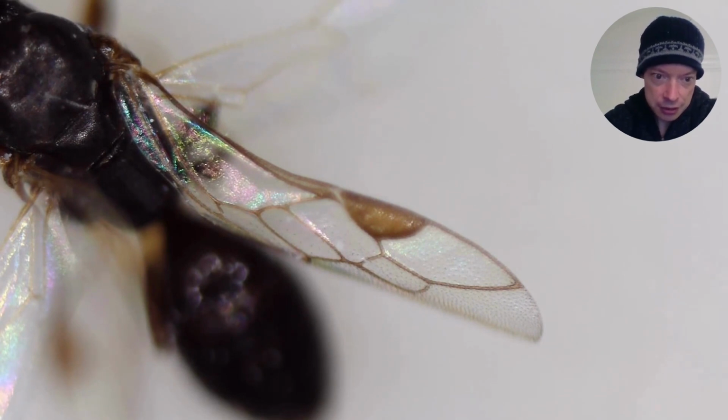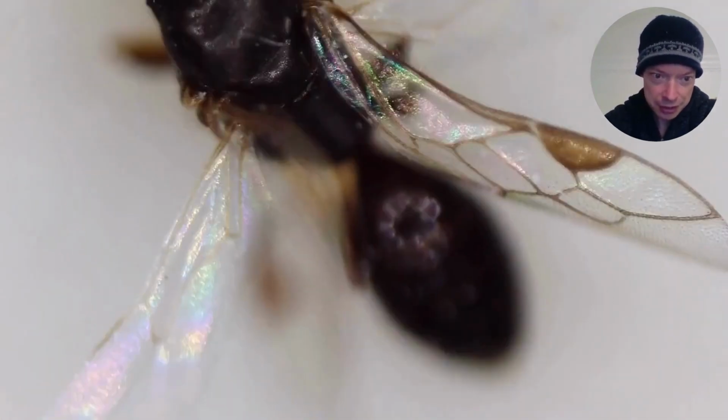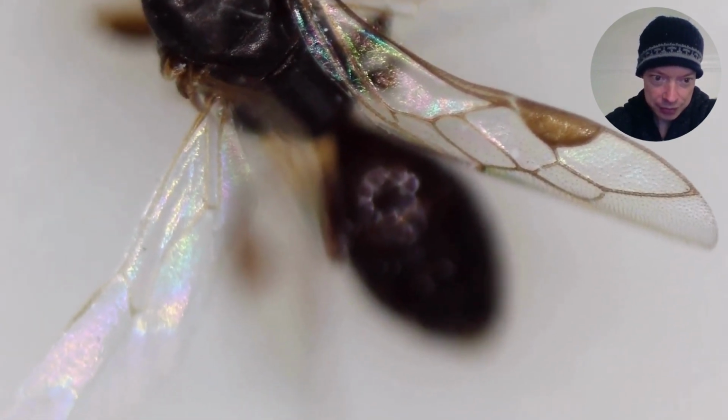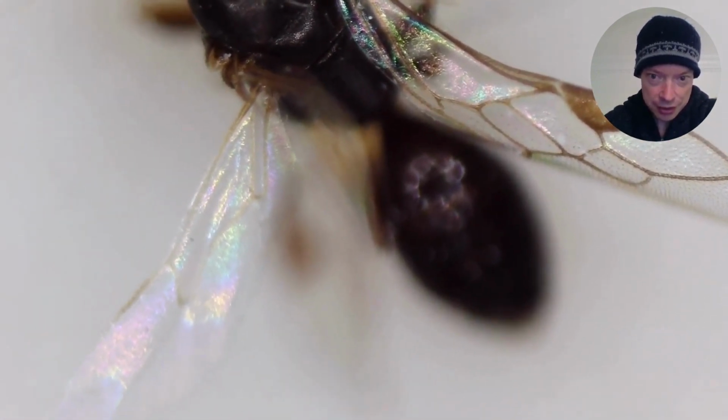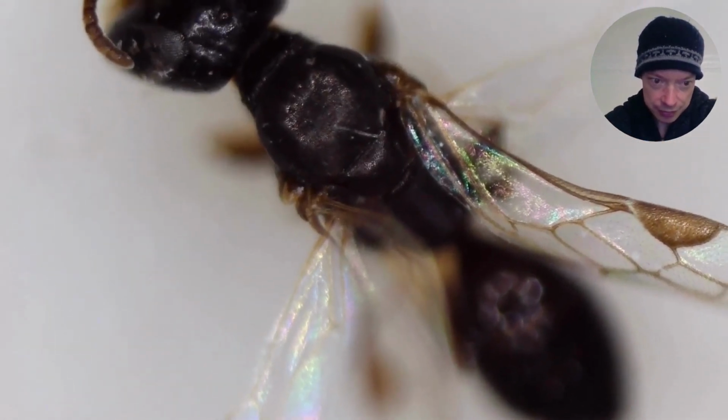And if you look at the top of the forewing, you can see these iridescent rainbow colours. You can see green, you can see blue, you see a bit of pink. So it's like a nice colourful rainbow. And we're going to have a look at the other forewing. There we're getting it in focus now. There's the other forewing with the pterostigma.